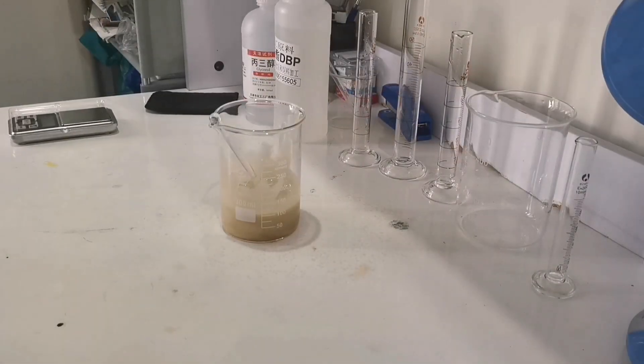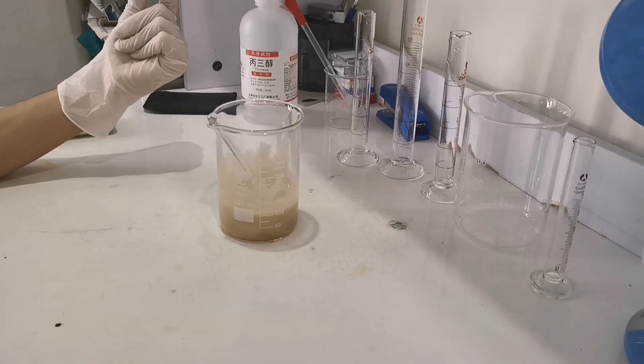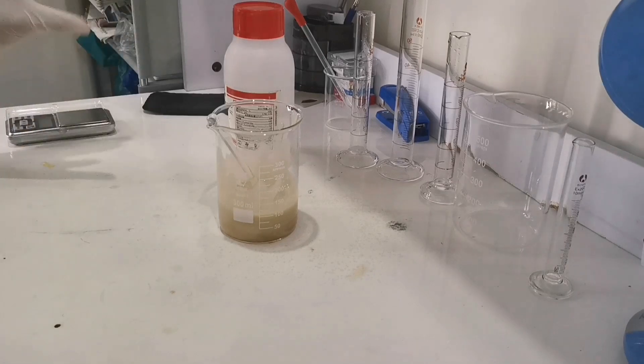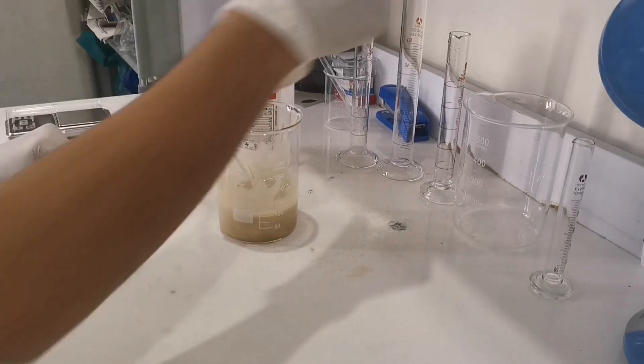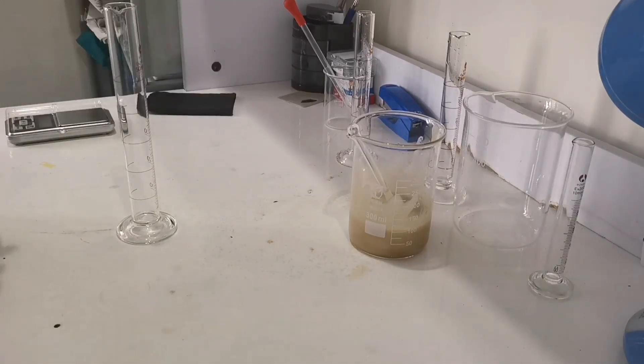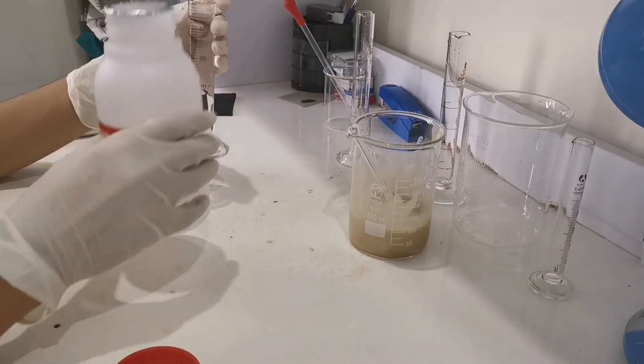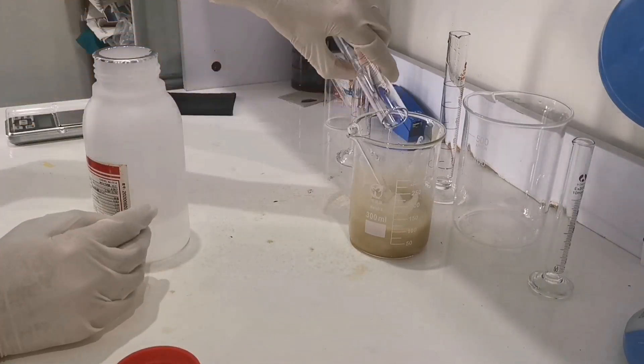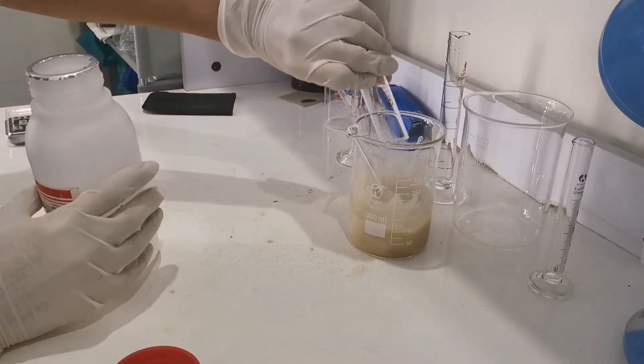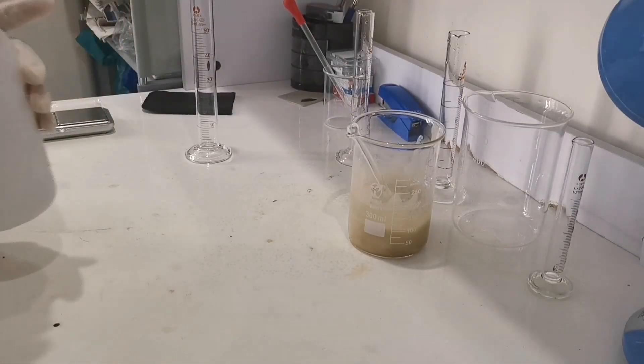After giving a good stir, we place it on the desk and we play some magic. You are right, we are nearly to the final step. We measure out 65 ml of ethanol into a measuring cylinder. Closing the bottle and like before, we give it a very good stir.